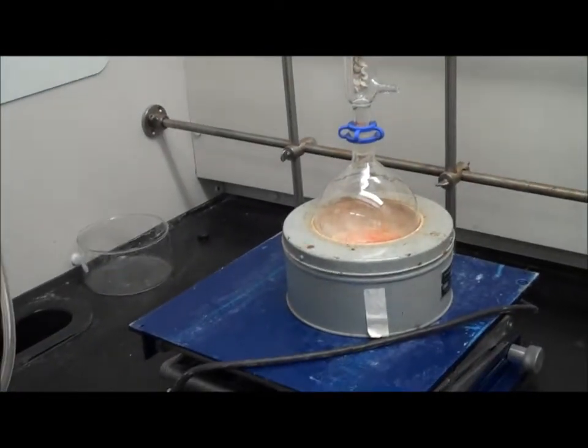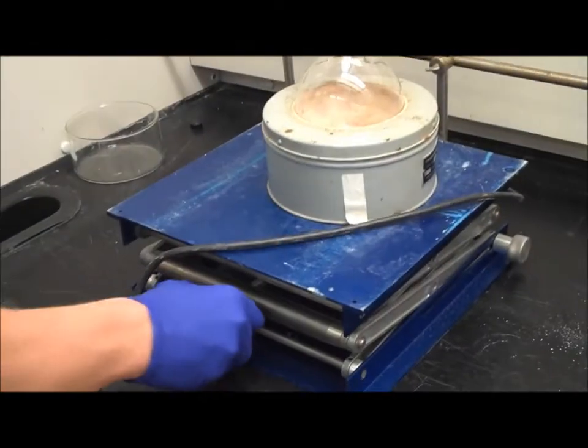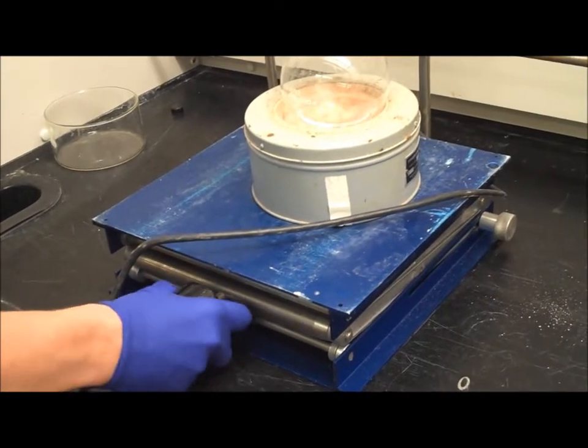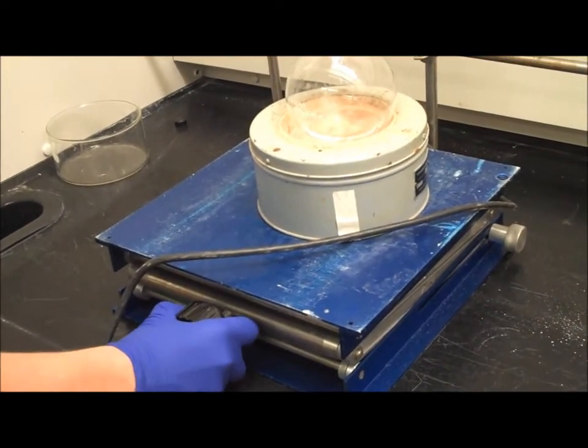Throughout this experiment, if you notice your solution is running low in the distillation flask, lower the jack to separate the distillation flask from the heating source, avoiding a possible explosion.